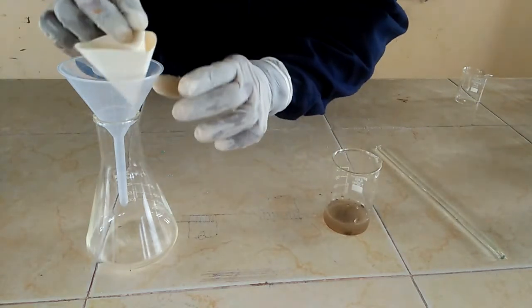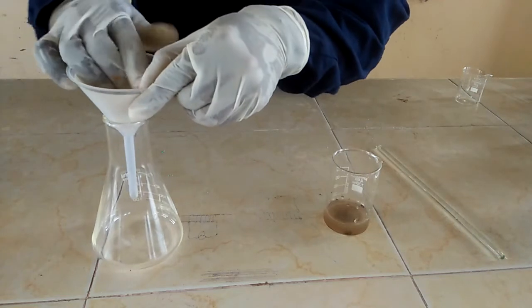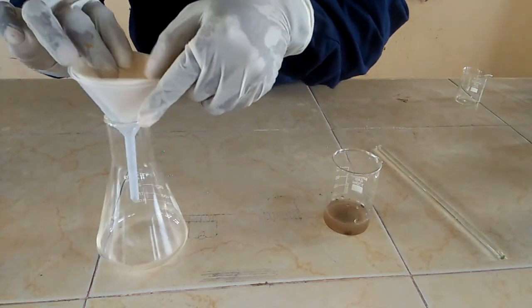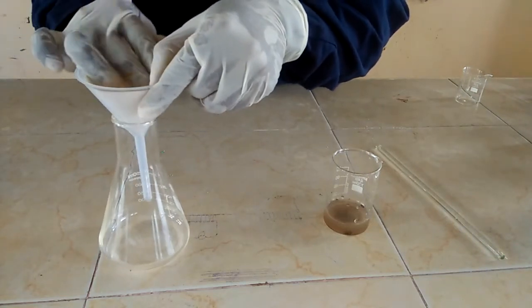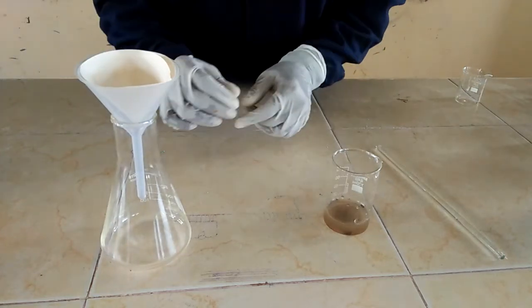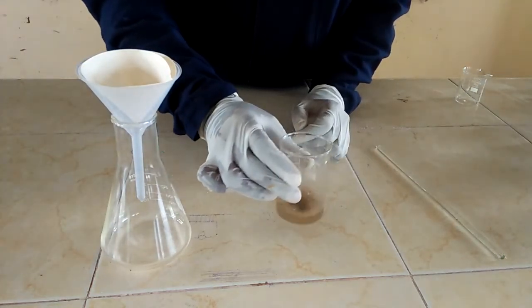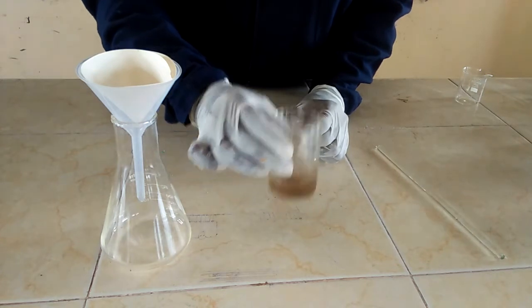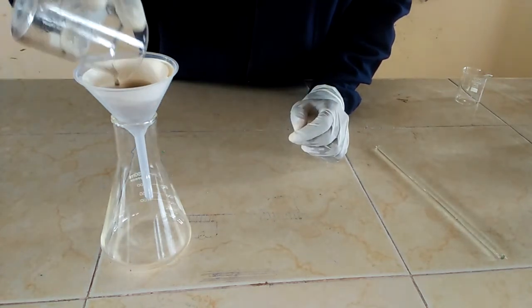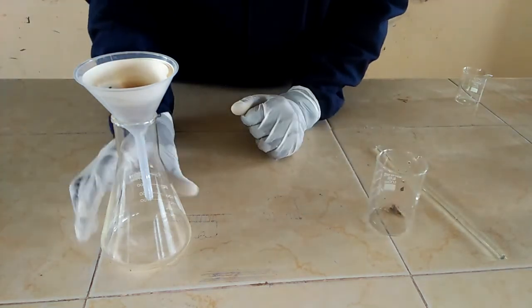Then I'm going to place the cone in a filter funnel. Make sure it fits well. Then transfer the mixture onto the filter paper and allow it to filter.